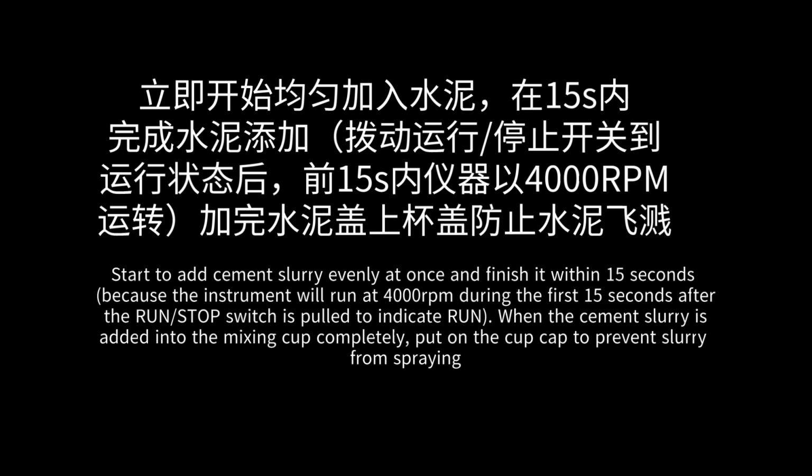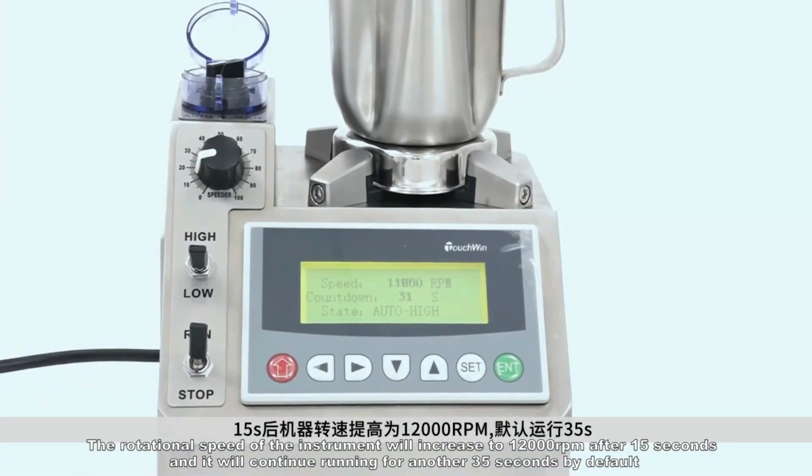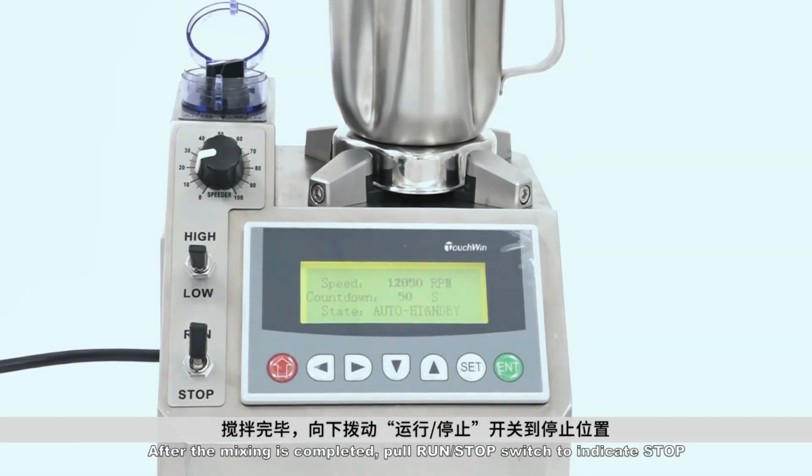When the cement slurry is added into the mixing cup completely, put on the cup cap to prevent slurry from spraying. The rotational speed of the instrument will increase to 12,000 revolutions per minute after 15 seconds, and it will continue running for another 35 seconds by default. After the mixing is completed, pull run stop switch to indicate stop.